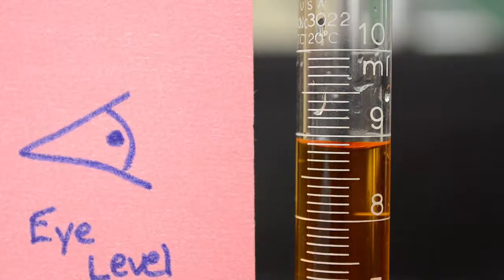So here we are. First thing we're going to do is take a look at the first digit. We are between 8 and 9. The liquid level, you can see the little meniscus, the little dip, is between 8 and 9. We would read this as 8 mL. We know that there is 8 mL, no more, so our first number would be 8.